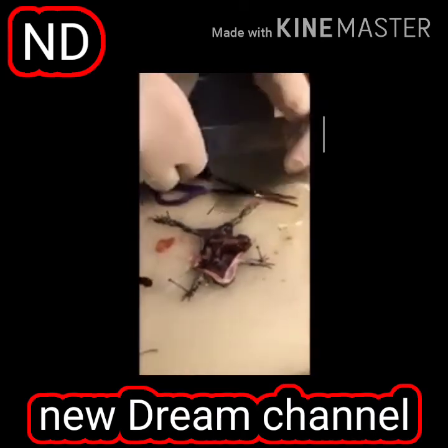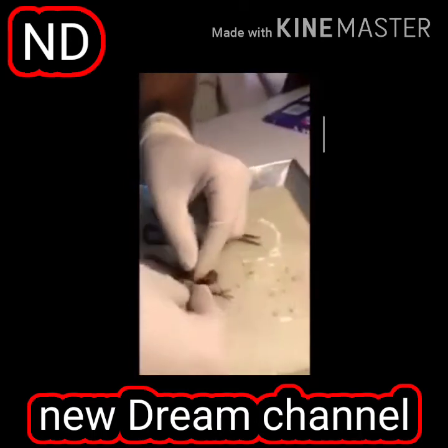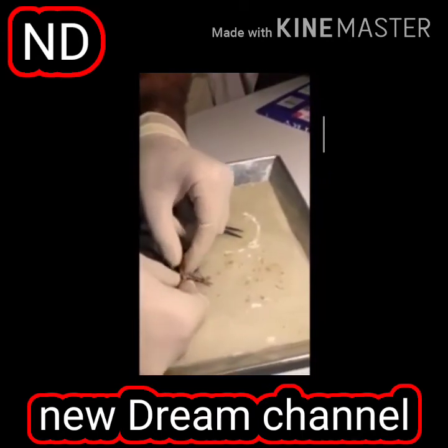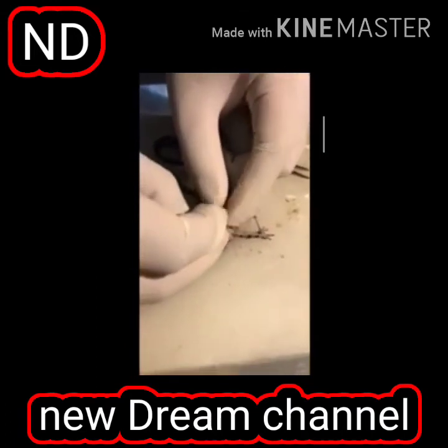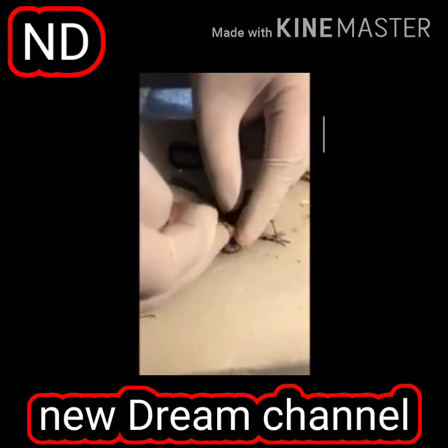So when it goes into the esophagus, we have here the mouth. We have here the mouth. I can take it like this. You see in the mouth there is a tongue. The tongue in the mouth is attached on the frontal side.